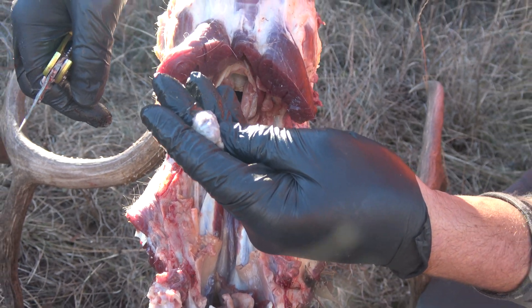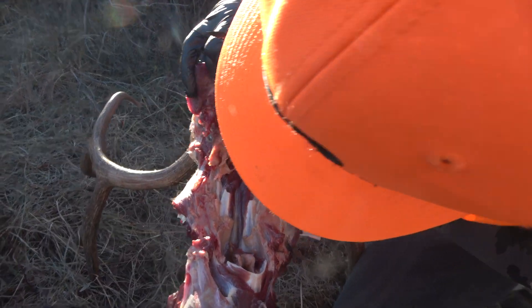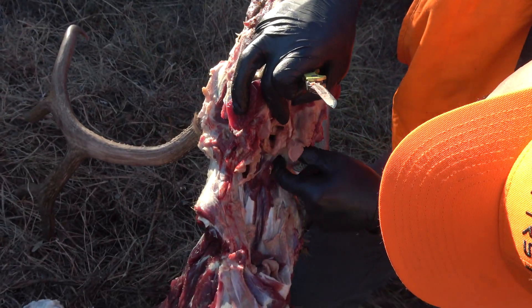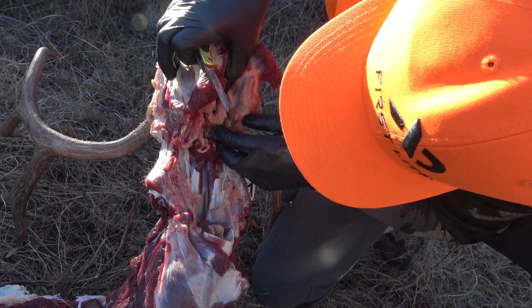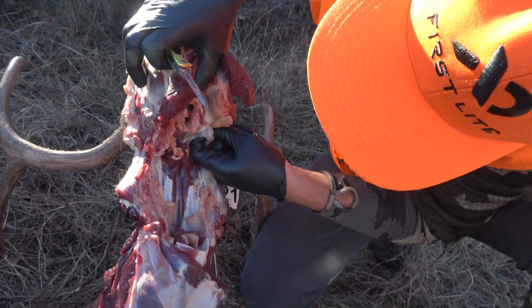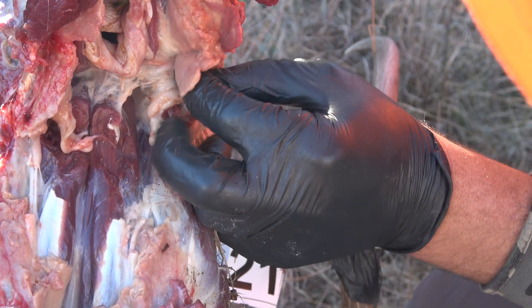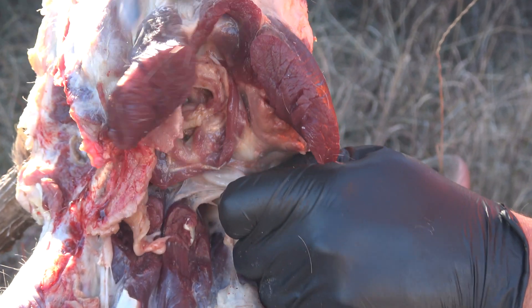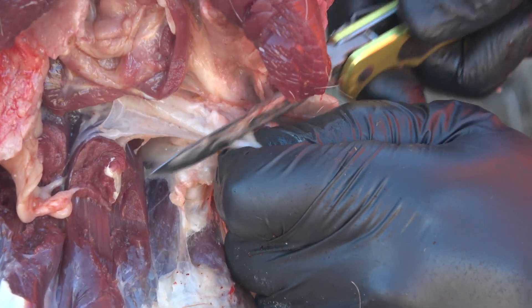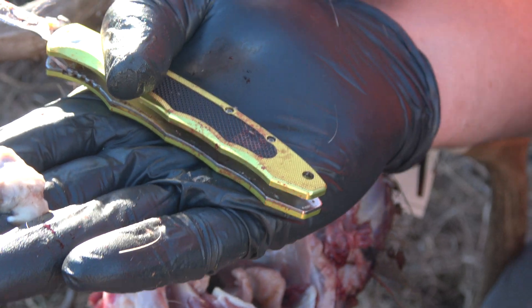Here's one, and we'll try to get the other one — let's go to the other side and dig in there. Sometimes you've got to cut away a little bit until you find it tucked in there. Here's the other one, right on the other side — it'll be one on each side right underneath that fatty tissue. There it is. Grab a hold of that — it's okay to leave a little fat on there too — and cut it out. That's the second one.